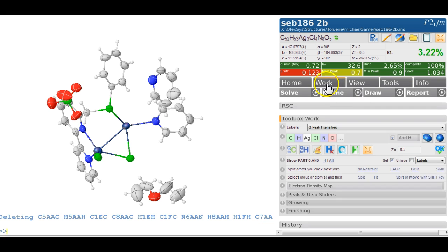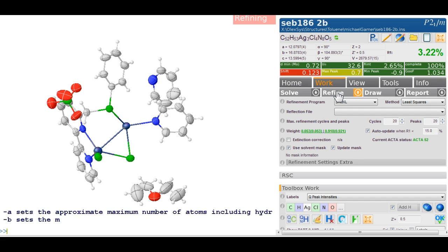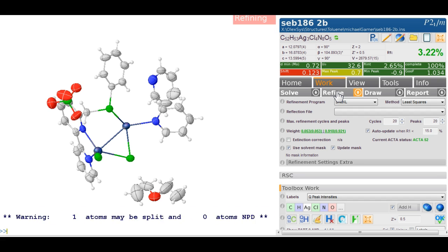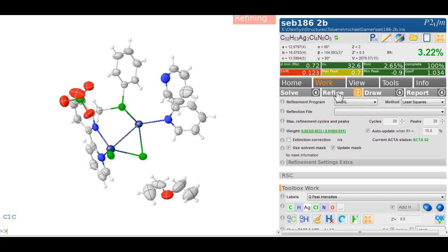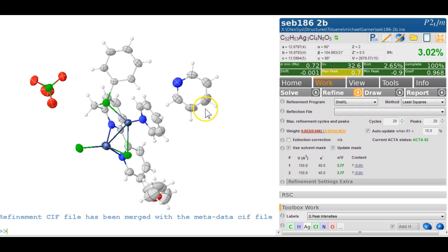And what I'm going to do now is click on the refinement and actually use a solvent mask. So we are going to update the mask, and that also switches on the use of the solvent mask. So when we refine this now, it will first calculate the area where this pyridine sits, and then it will evaluate the electrons that must be in there. And this will basically get rid of this, and we now have an R factor of 3.02. We've got 40 electrons. How many does a pyridine have? I could do adding up, or I could double click on this and type info, and the electron count is 42. So that's a very close match to the number of electrons we find in there.